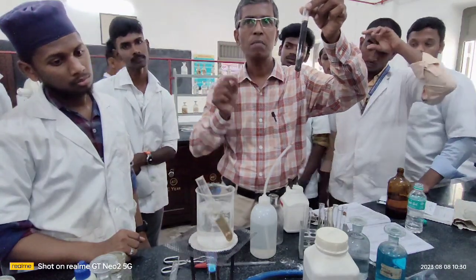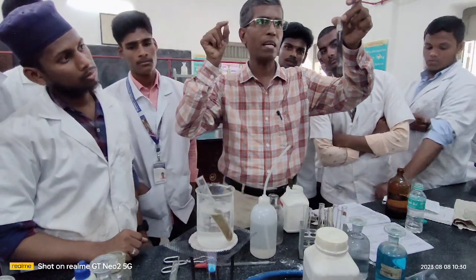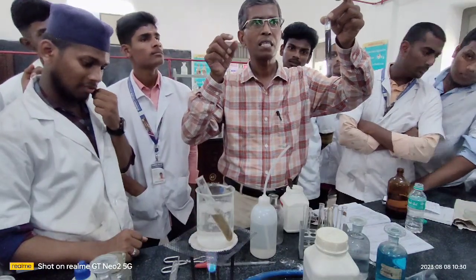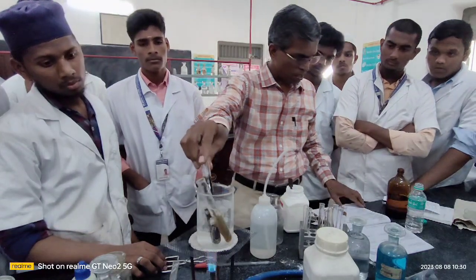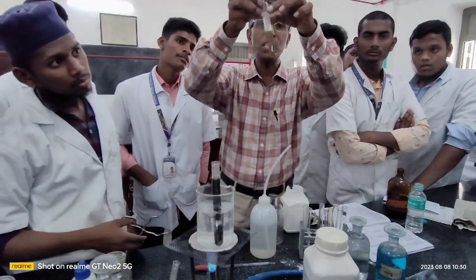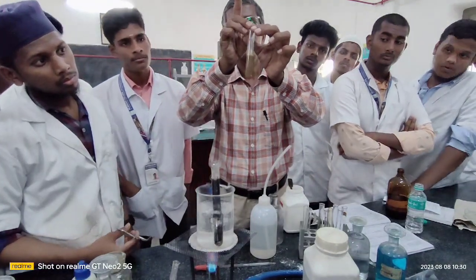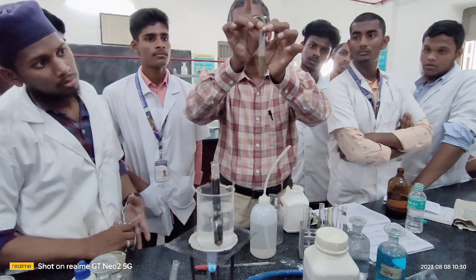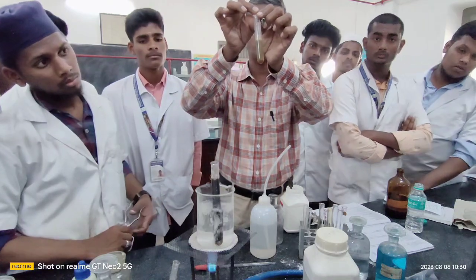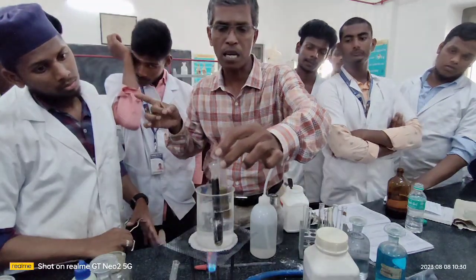And one more test is by mixing Fehling's solution A, Fehling's solution B and the organic compound in water and keeping it at least 20 minutes in the boiling water. You will get a red brown precipitate. See here, the formation of red brown has already started. This is again 10 minutes of time. Now I am in a hurry, therefore I have taken this out of the boiling water. Anyway, you can see the formation of a brown precipitate. This confirms again the presence of carbohydrate as a functional group in your organic compound.